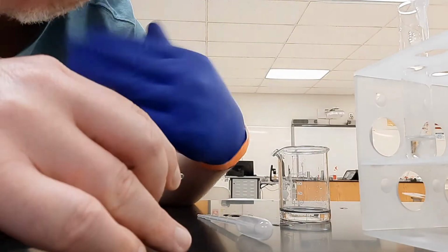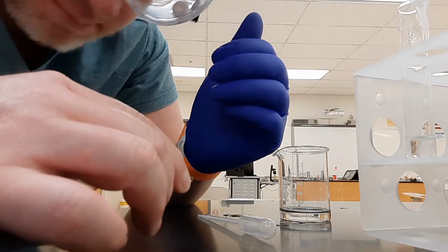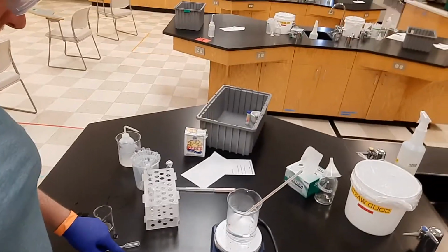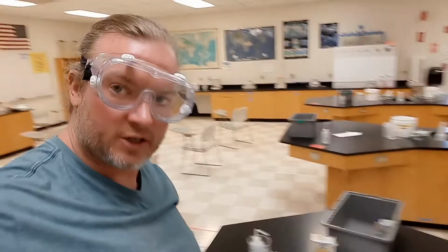Okay, so I can definitely smell that now. That's a pleasant fragrance right there. But that is the final step, so to speak, of setting this up, trying to smell that fragrance here. Hope this is helpful in trying to do the experimental setup for the esterification for Making Esters Lab.